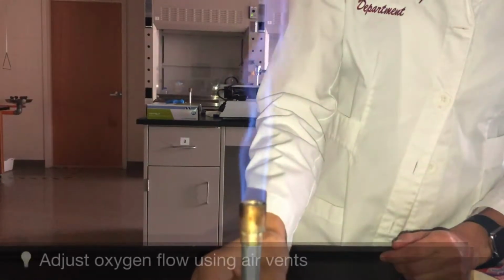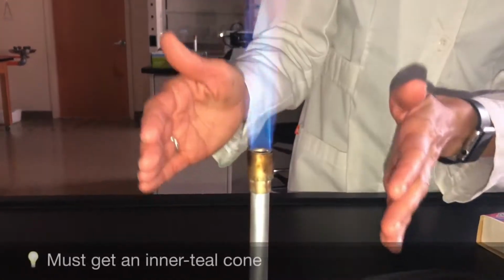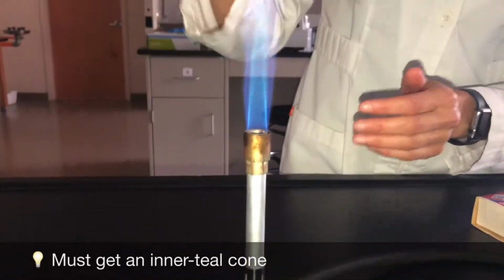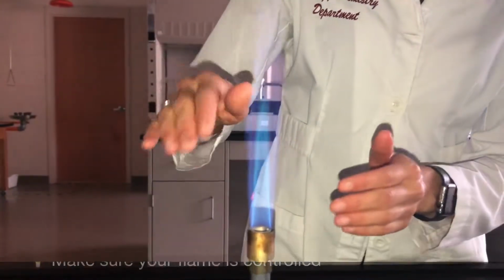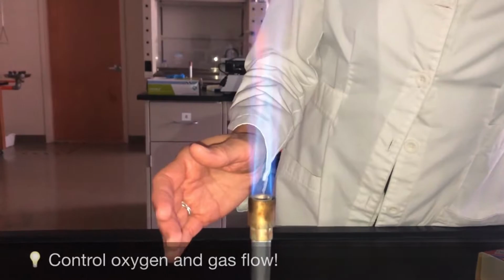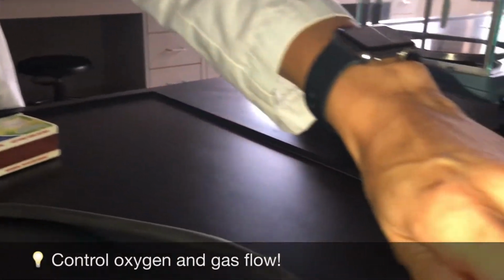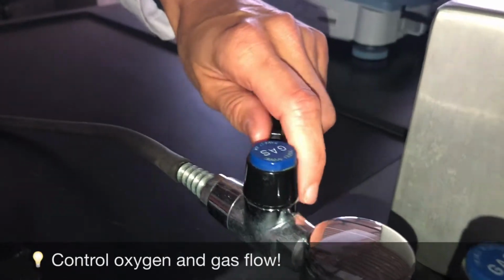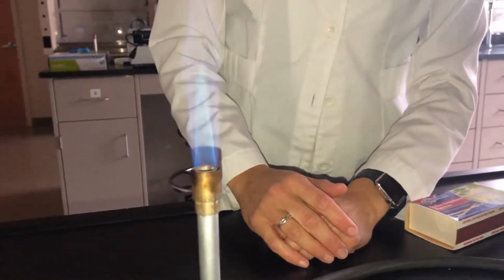So then you want to adjust the air valves until you get this nice inner teal cone. You also want to make sure that the flame is controllable, so you don't want a blowtorch all the way to the ceiling. So you want to control the amount of oxygen. And now we have a nice controlled flame, and then you would observe the flame and make your observations.